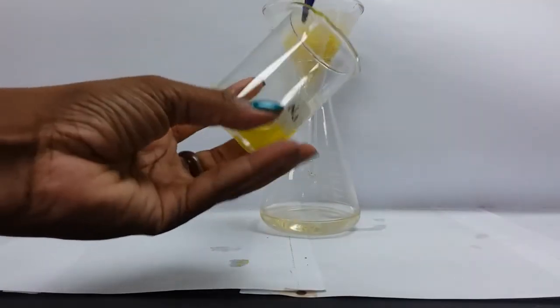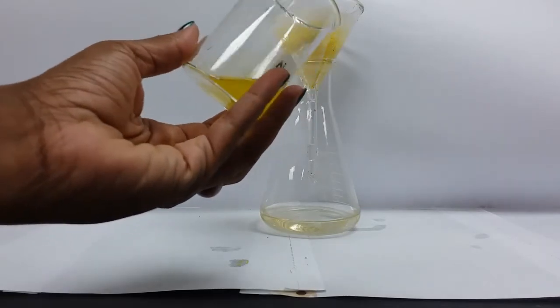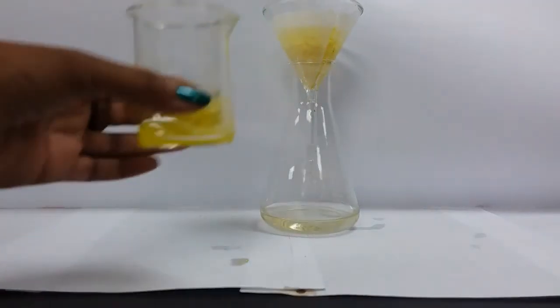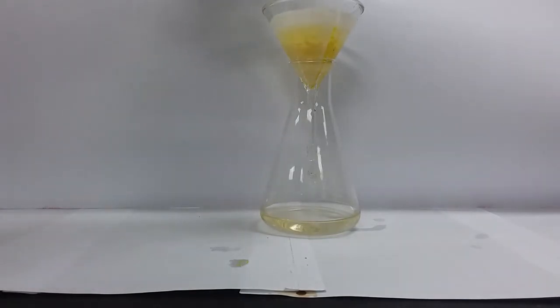So this is what is described as rinsing my apparatus, where I'll just take some water and ensure that all of my residue has been transferred to the filter paper.